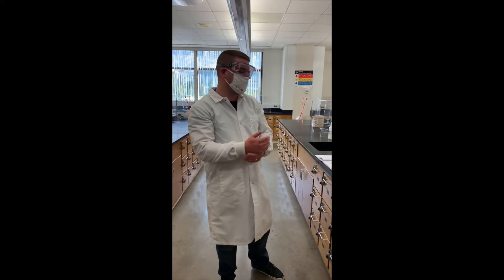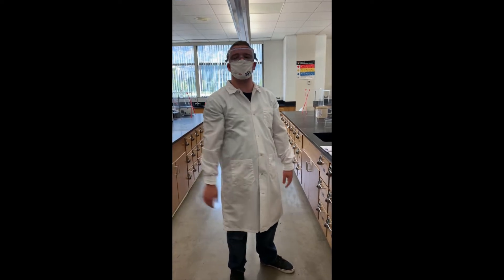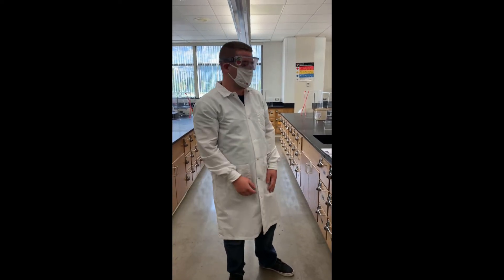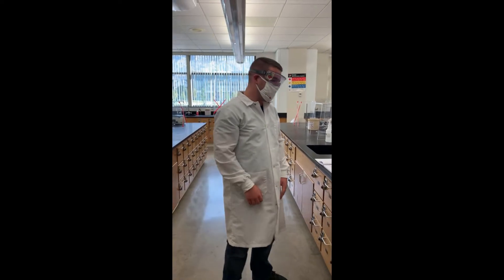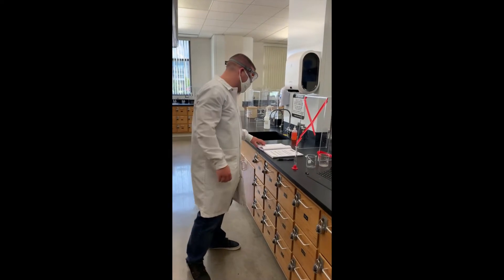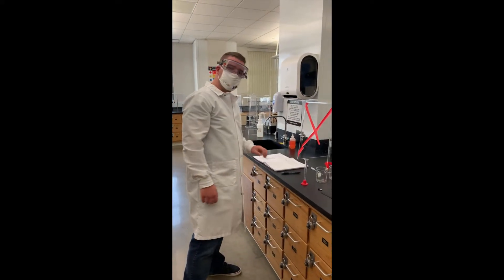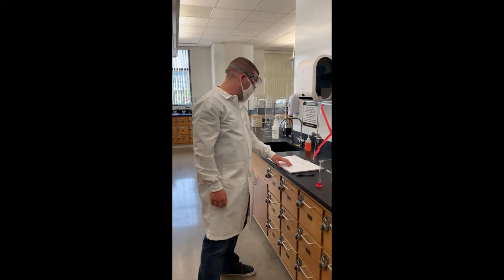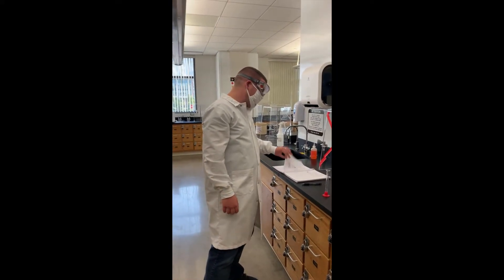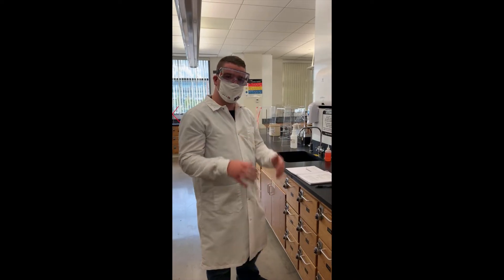Hi, my name is Benjamin Frotcham. I'm going to be showing you the Experiment 3 Procedure. So first, just so you know, we're starting on Part 2 and I've just completed Step 8, which is the whole setup.